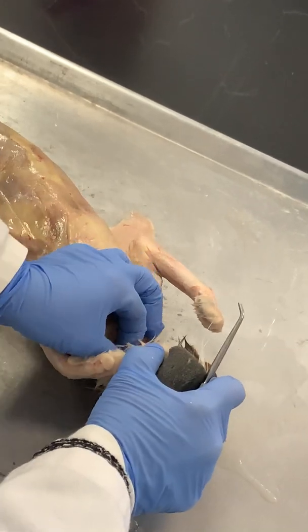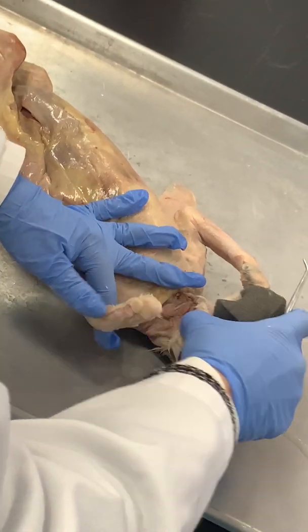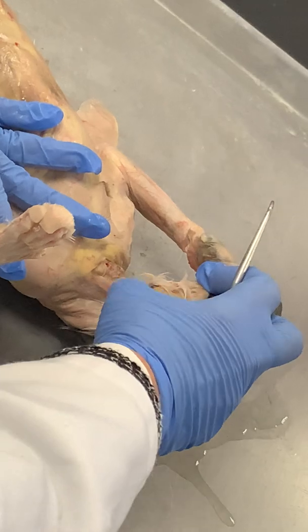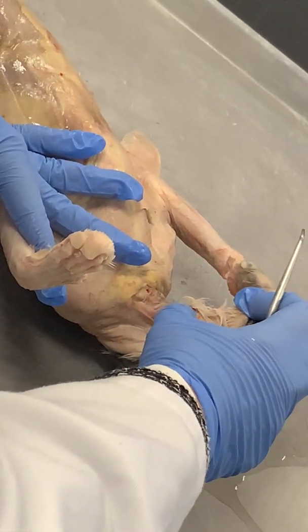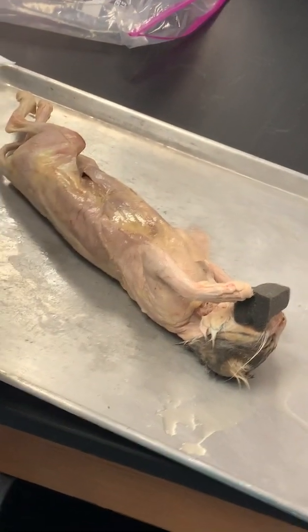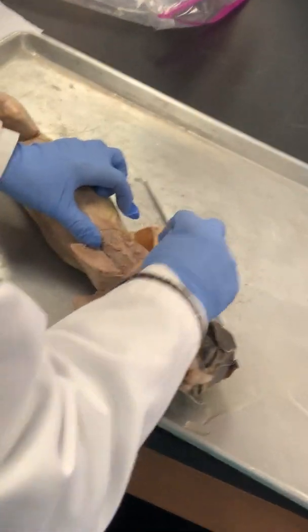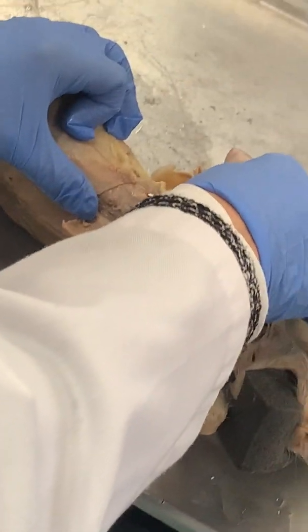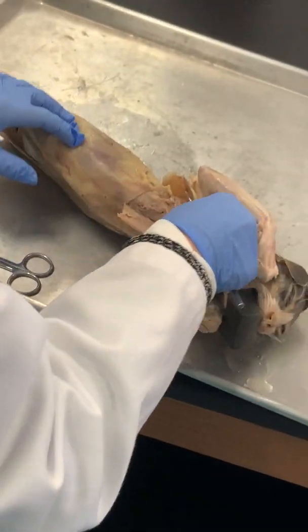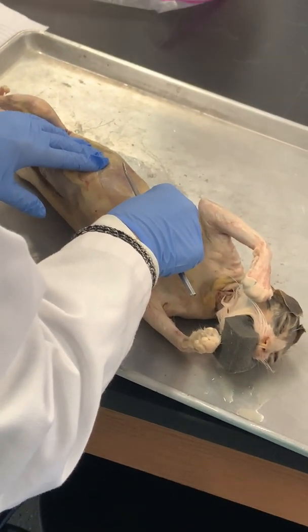Right under the skin here, when I'm pulling up on this — what muscle would that be? Platysma. Now we could dissect out the sternocleidomastoid but it's right there, part of it — it's a lot easier just to do on the model, plus it'll ruin some of these blood vessels. Serratus anterior — I didn't have a good one. Oh yeah, kind of — see how it serrates there? That's serratus anterior.